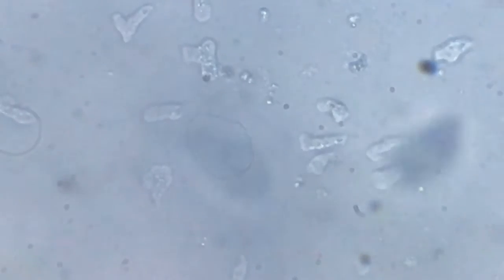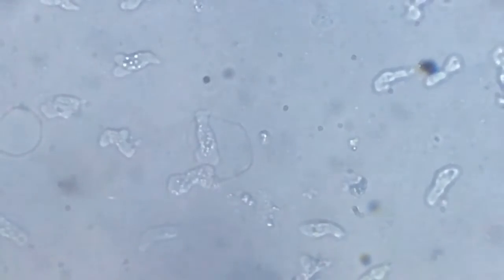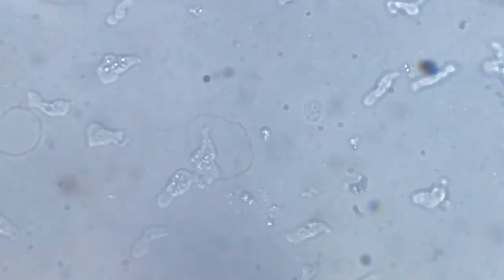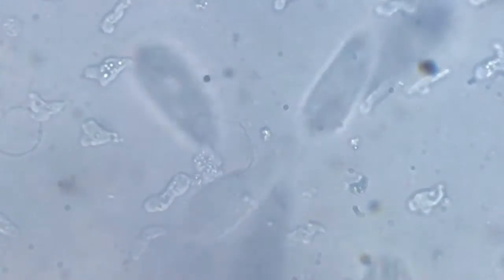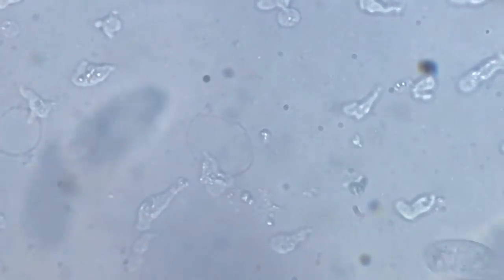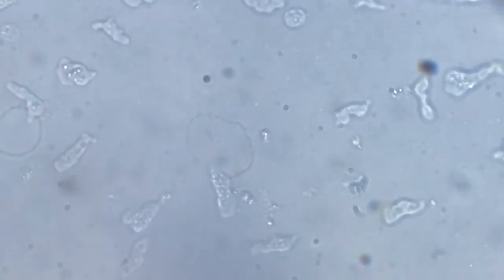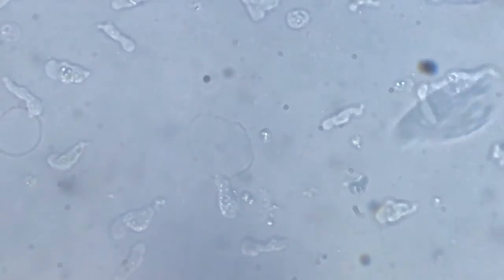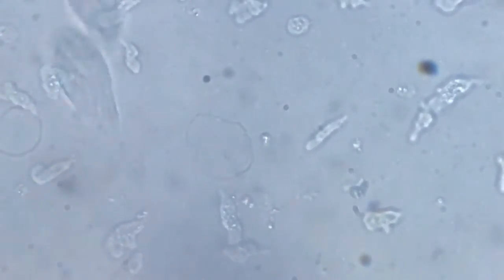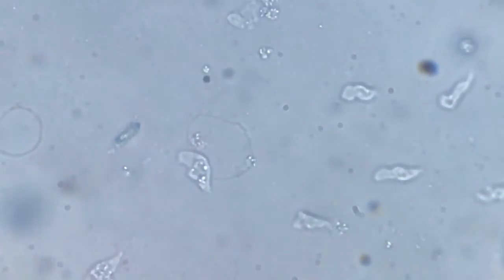So there are numerous amoeba on the slide, as we can see. And remember, this slide has just a droplet of water, and it has the decaying part of a dead dipteran larva, and there are a lot of ciliates on the slide, a lot of rotifers, ciliates, and now we also see a good number of amoeba. So they are all moving out away from the larva, the dead larva.